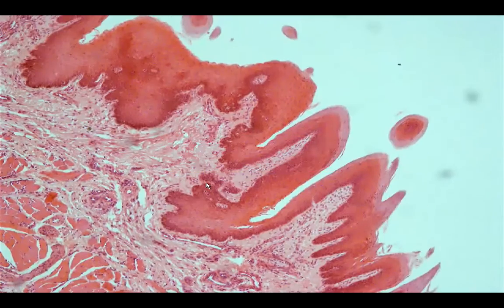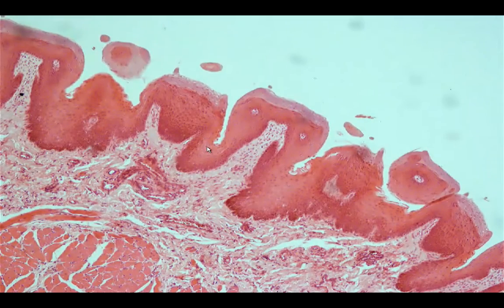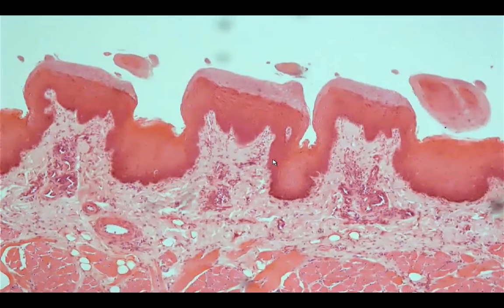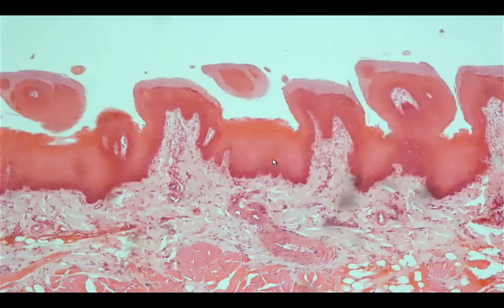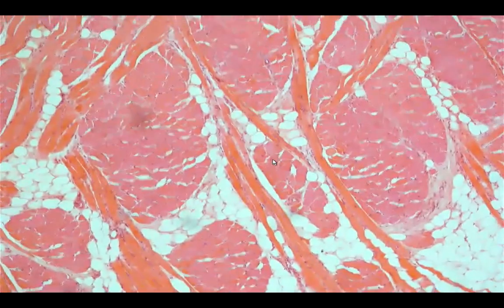And then in this particular area, you can see the presence of these projections. If you're going to run down your tongue on the surface, you can see that it looks like you have a lot of these projections. These are what we call the papillae. Okay, and some of them would contain taste buds, although in this particular area, I do not see the taste buds present. Okay, let's center on what is important in our topic, and this would be the skeletal muscle.